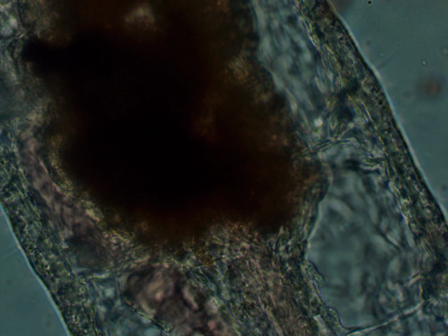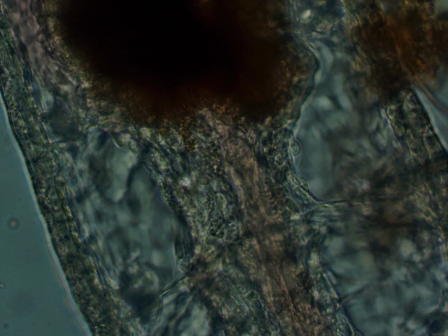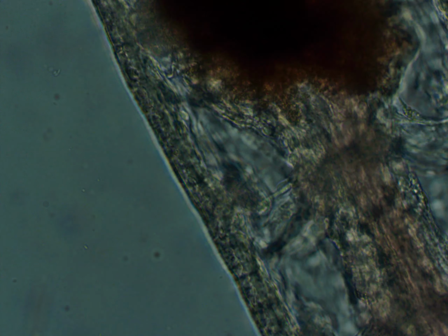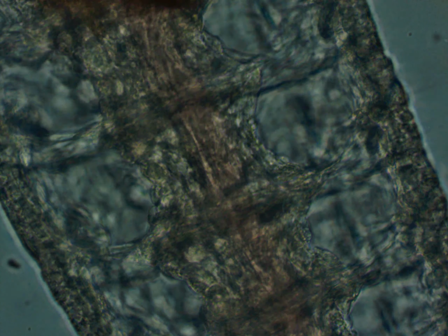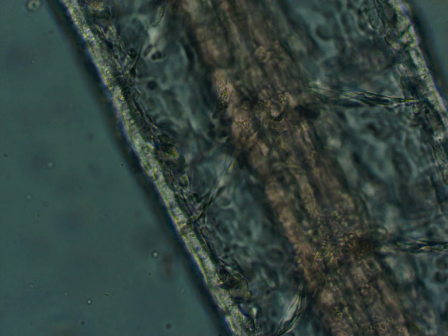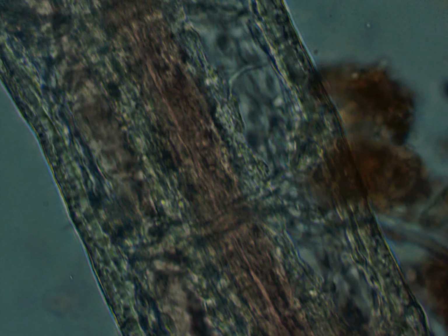And you can see that food going down this digestive tract, and you can see it in that cordage, which isn't actually a word. It looks like it is moving down that, and it seems to be flexible. Very flexible, because it is holding that large of a thing, and when it goes down, you can see it moving around that piece of dirt. Just like that. You can see the outline of all of that dirt, which is also flowing down the annelid.